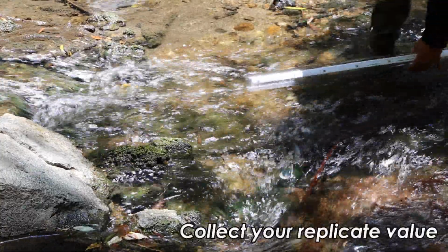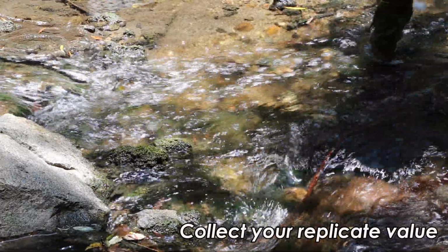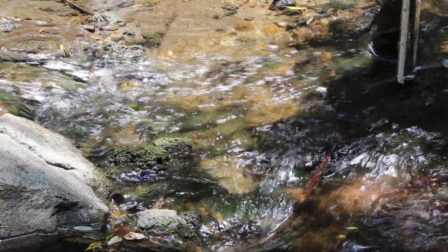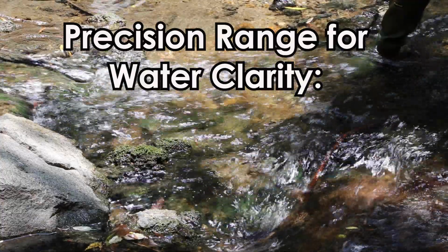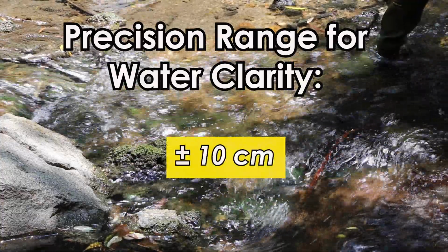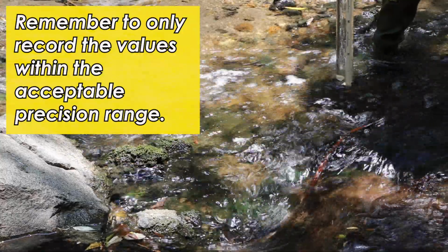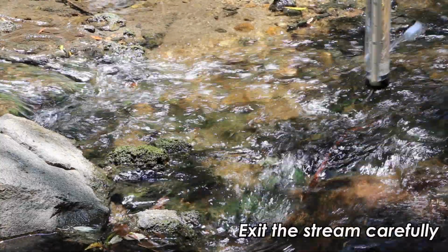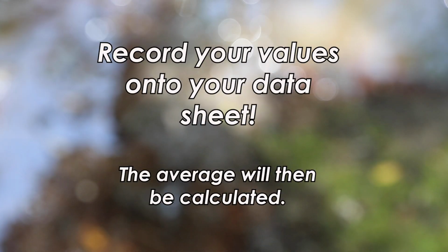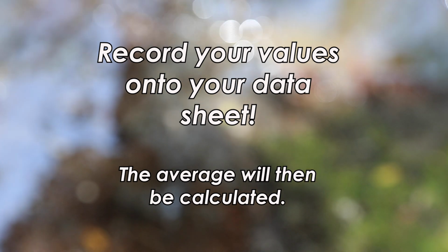To collect your replicates, repeat these steps for gathering your sample in your transparency tube. The values of the 2 replicates to be recorded on your data sheet must be within the acceptable precision range of plus or minus 10 centimeters for water clarity. If the values you have are outside of the precision range from each other, continue on with additional replicates until you have 2 values that are within the precision range. Finally, record the 2 values within the acceptable range on your data sheet to then calculate the average.